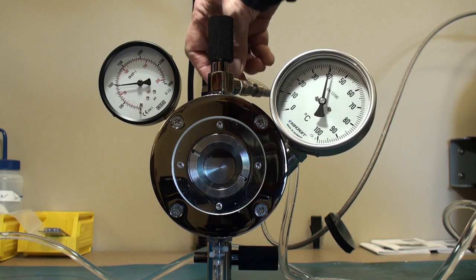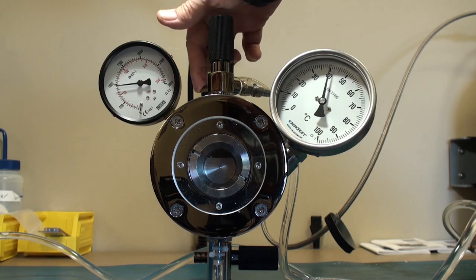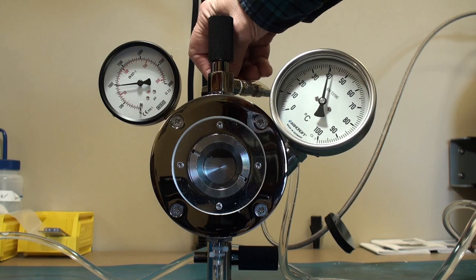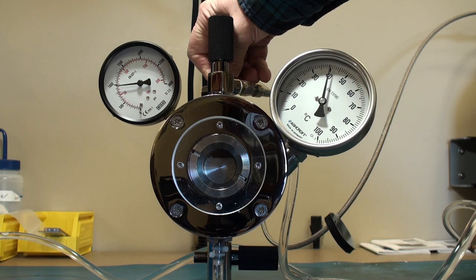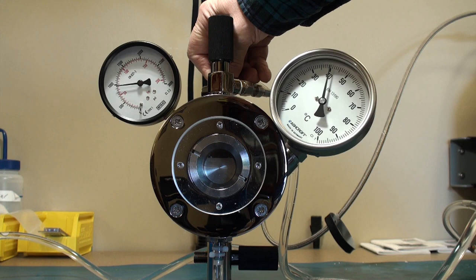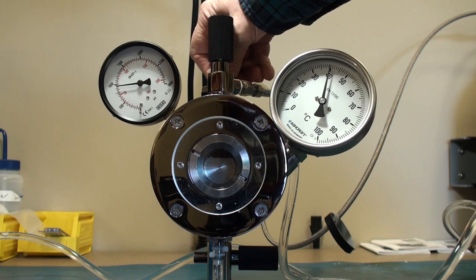You can hear without me turning the, the gas flow is slowing. So it requires some vigilance to maintain approximately that 100 PSI per minute reduction in pressure.